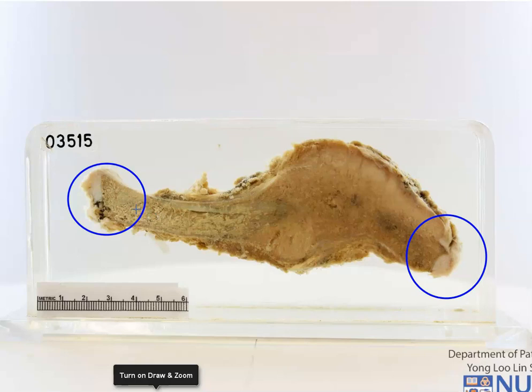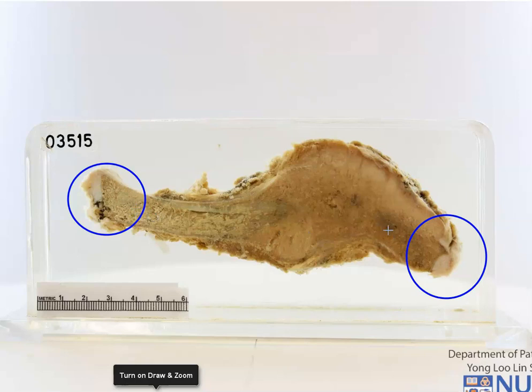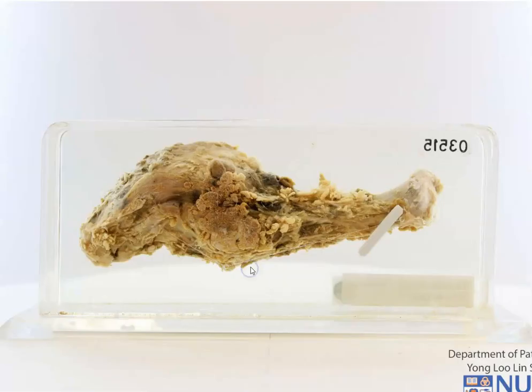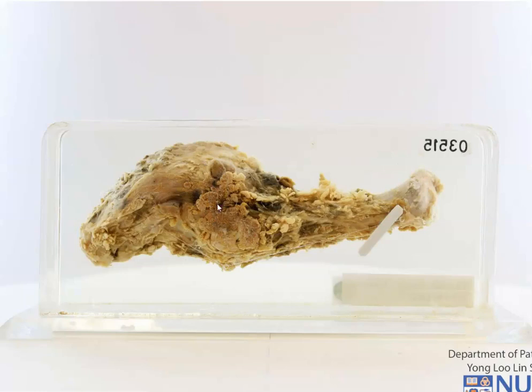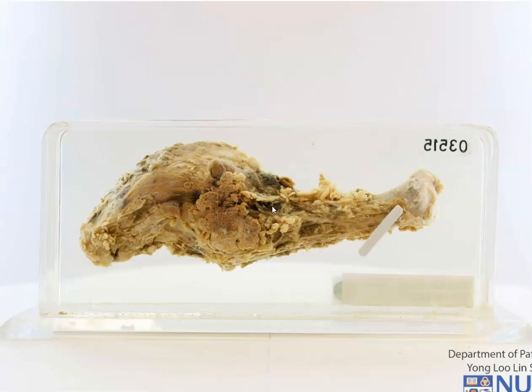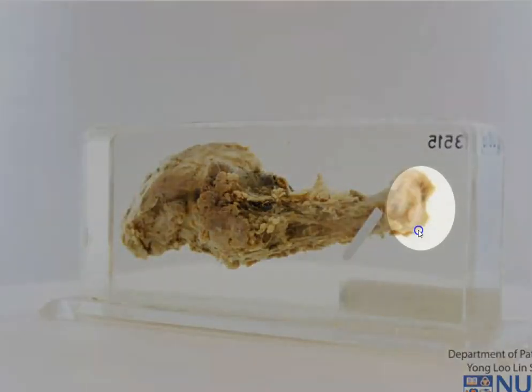Therefore, we can surmise that this is not the clavicle of a mature adult — this belongs to a child. Let me turn the specimen around. This is some of the soft tissue, the fatty tissue, and the darker skeletal muscle that is around the bone, and here is the articular surface.